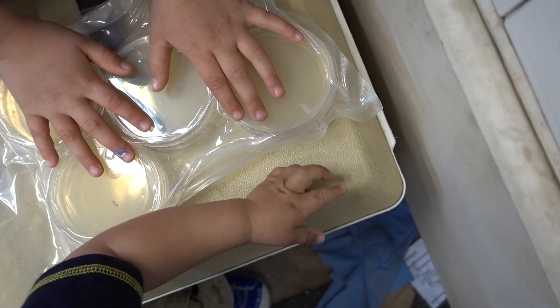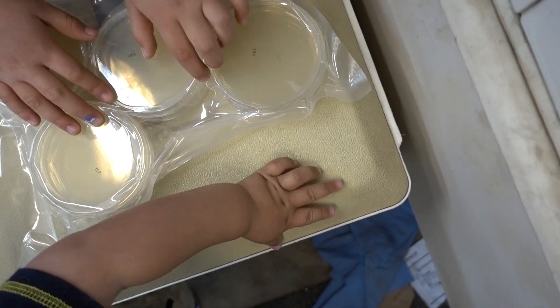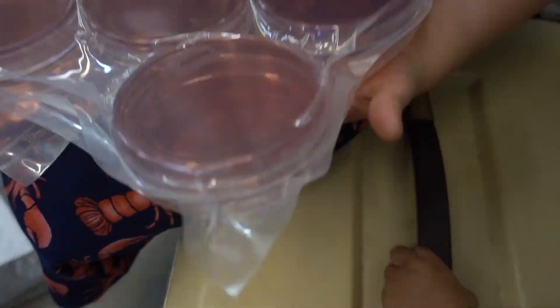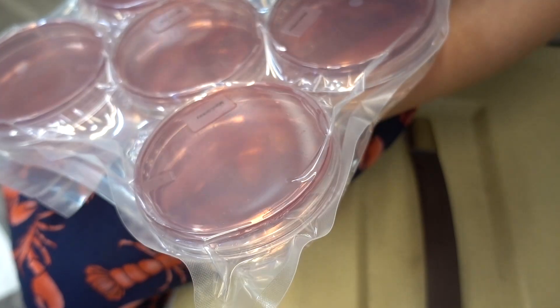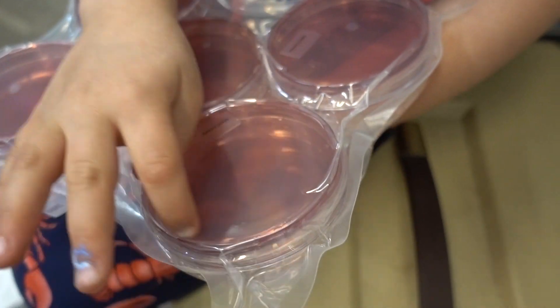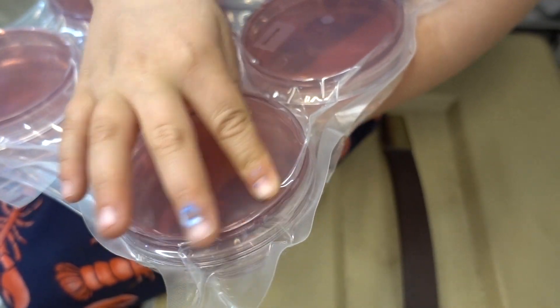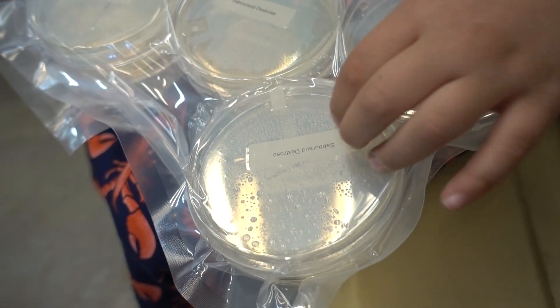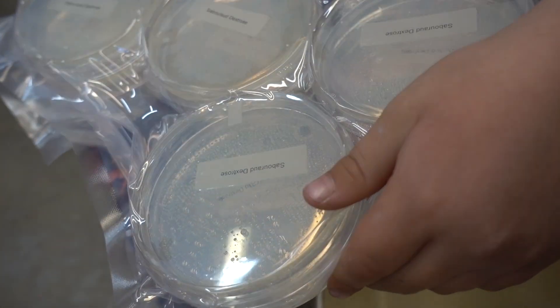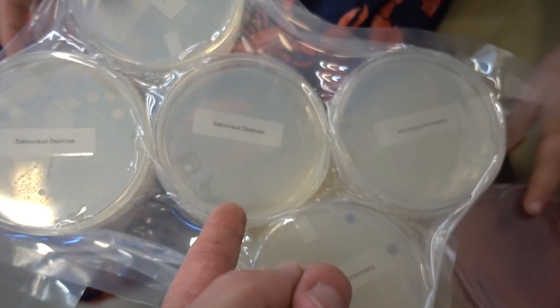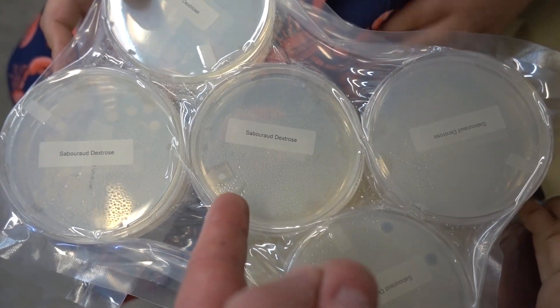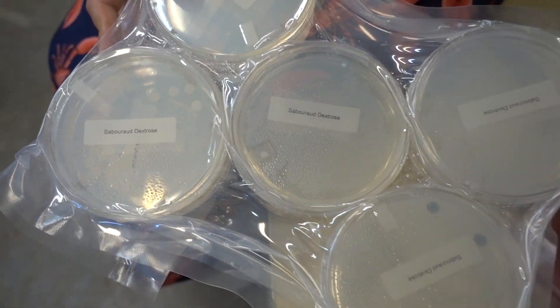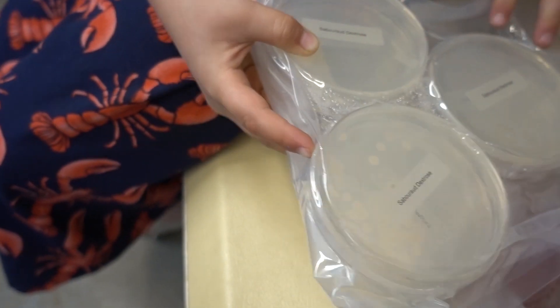So you think we're going to find some Shigella and E. coli on your hands? Yep. Boys and girls, this is MacConkey agar. And what kind of bacteria grow in MacConkey agar? Shigella, that's right. Saburo, I can't say it. You're being lazy. That's okay. I feel lazy sometimes too. This is for yeasts and fungus. Fungus amungus?